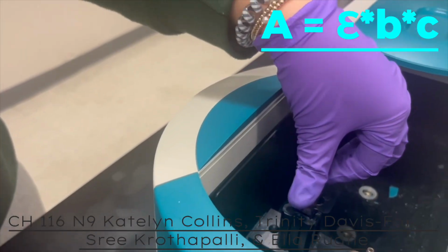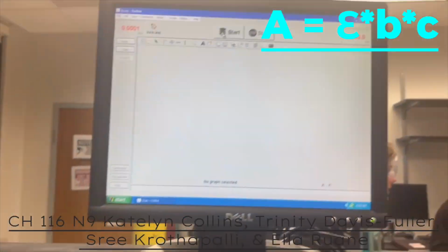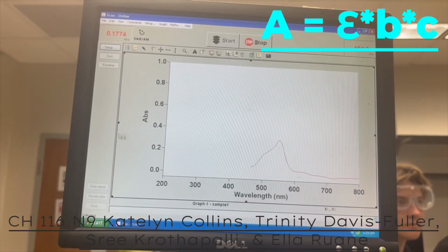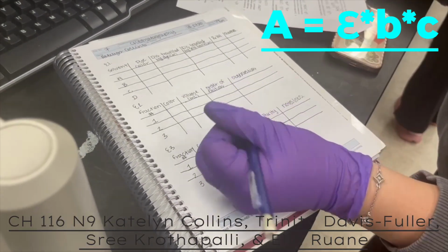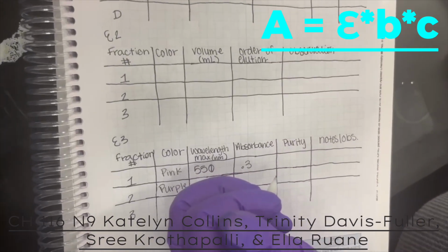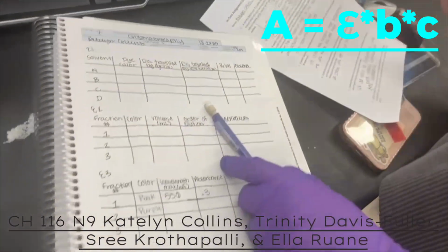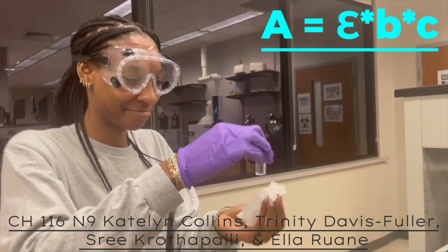The epsilon is indicative of molar absorptivity, which can be determined by finding the slope of the line that forms from graphing the collected data points. B is the path length, or distance the light travels through the sample. For a standard cuvette, B equals 1 centimeter. C is the concentration, or the amount of the absorbing species in the solution. This can be calculated using a calibration curve or by rearranging this equation after measuring absorbance.